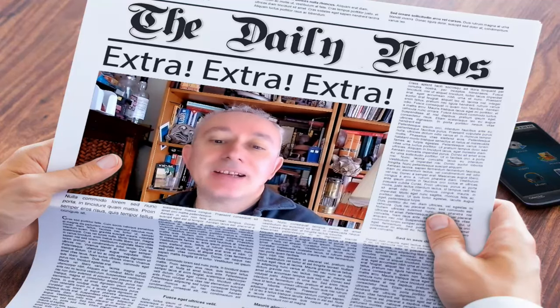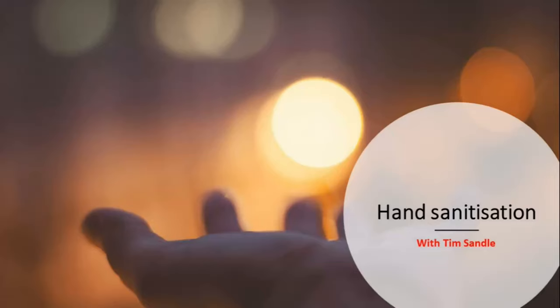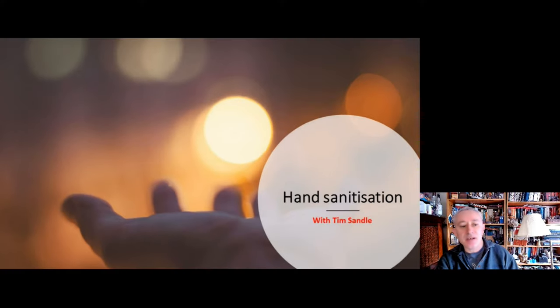For this video we're going to be looking at hand sanitization techniques. This week's presentation is all about hand sanitization, which is a fundamental technique to keep the hands free from microorganisms and is really important to working in clean rooms, particularly in aseptic processing facilities. I'm just going to run through a bit about the background of hand sanitization, then give a demo, and then we'll conclude with emphasizing the importance of the hand sanitization technique.